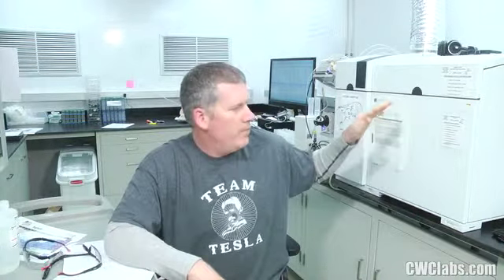Don't think, oh, I only need 12 minutes warm-up time. No, you need more. You need at least 20 minutes. And these days, I've been running it an hour before I even start to run samples. An hour, that's what I do. But don't take shortcuts with this machine. If you take shortcuts, you're going to get some backlash from it.